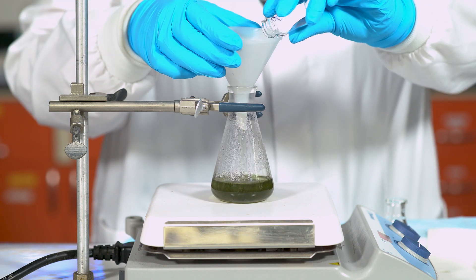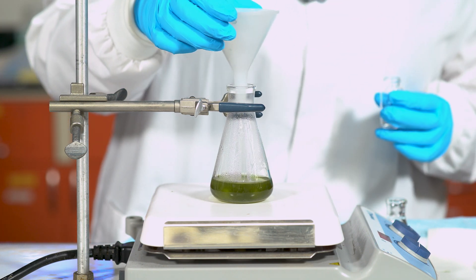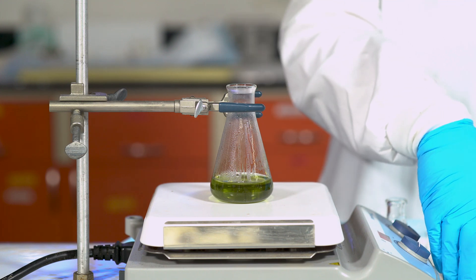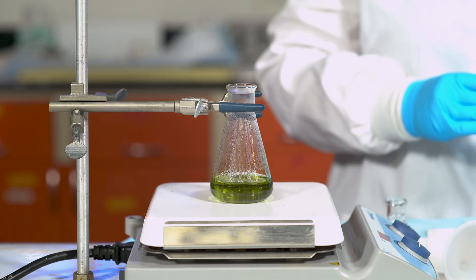The color change from dark green to bright yellow indicates the uranium has gone from the 4+ oxidation state to the 6+ oxidation state, producing uranyl nitrate.